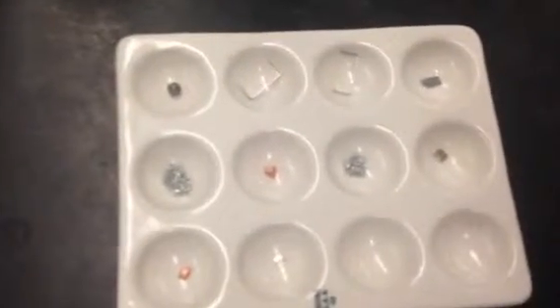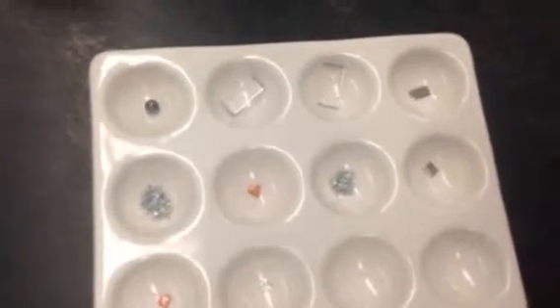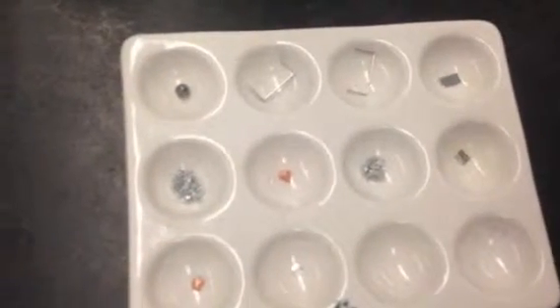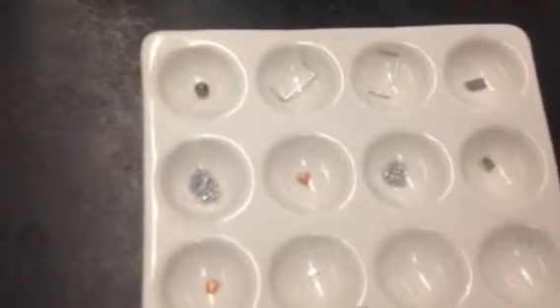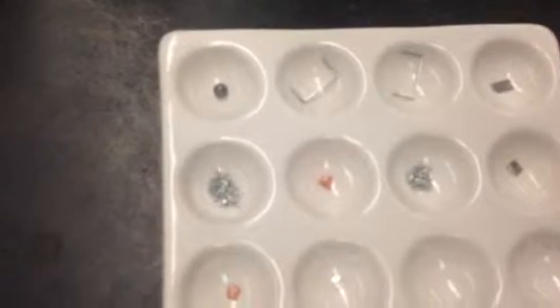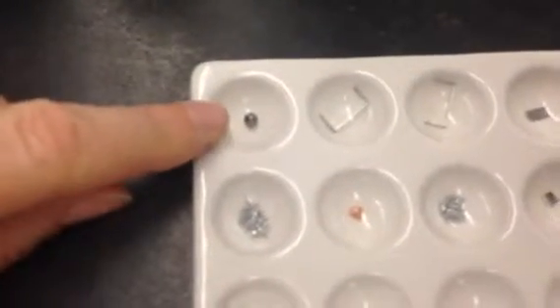These would be the elemental species that are, again, not a part of a compound that you see on your sheet. So they may be listed as chemical 1 or chemical 2. You can tell what the elemental species is because it's just the name of one element. So for example, in the first combination, you've got copper 2 chloride and lead. So when we look in this first well here, this is lead.